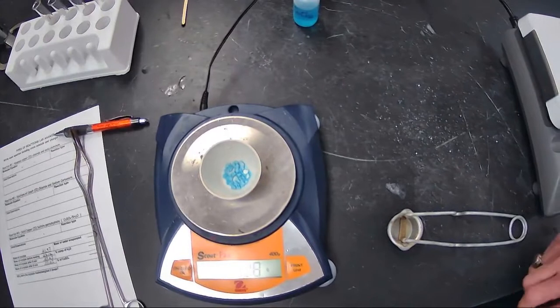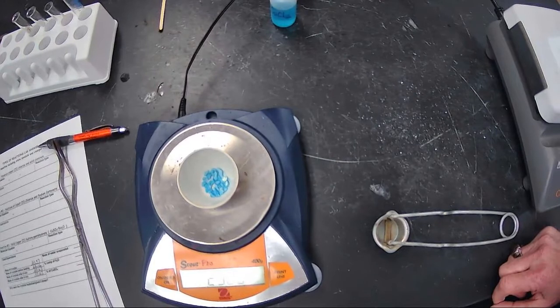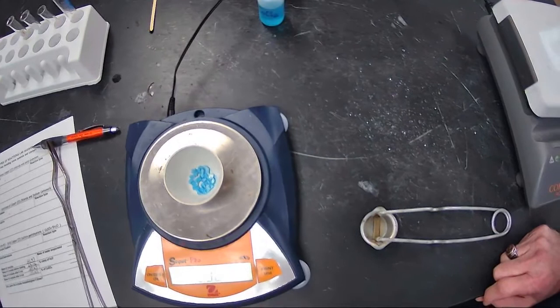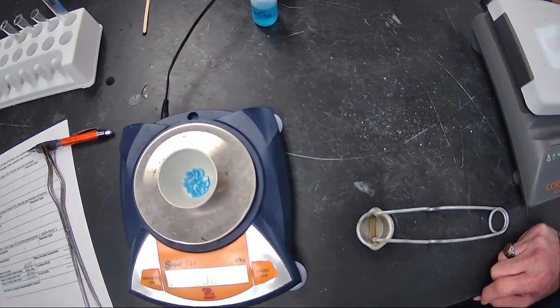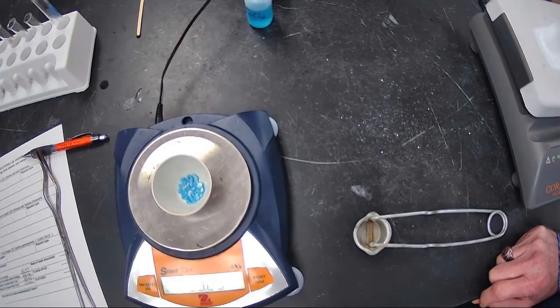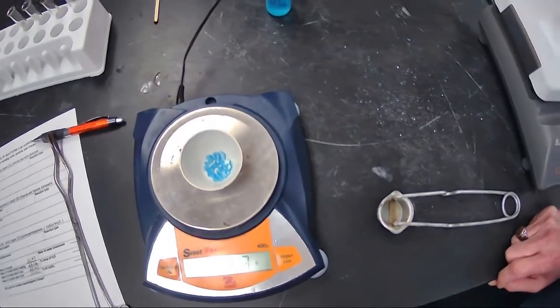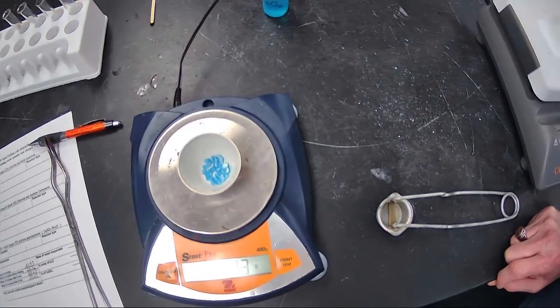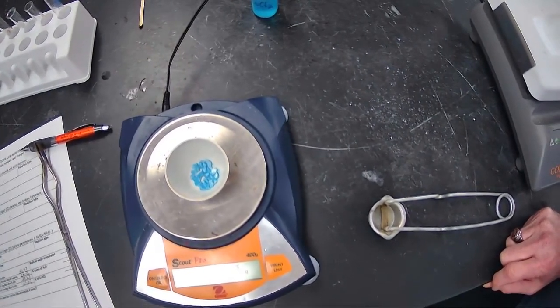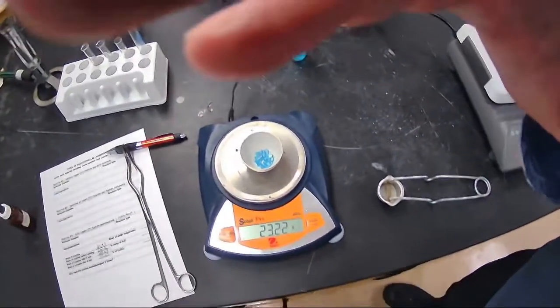There we go. So we can see that we're reacting and forcing water and the copper 2 sulfate to come back together to make that rehydrated compound again. So it went from that light gray color back to its blue color. It's not as dark blue as it was because it was really, really intense blue, but we could add more water to it and probably get that color to come back out a little bit. But you can see when you add water back to that and rehydrate it, the dehydrated compound now reforms the crystals. Cool.